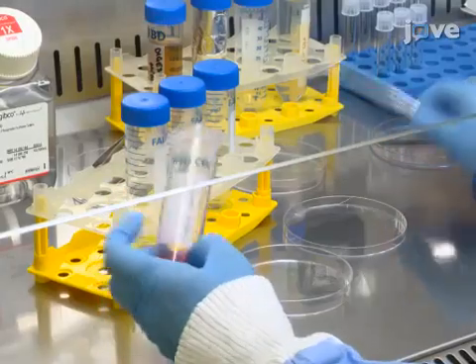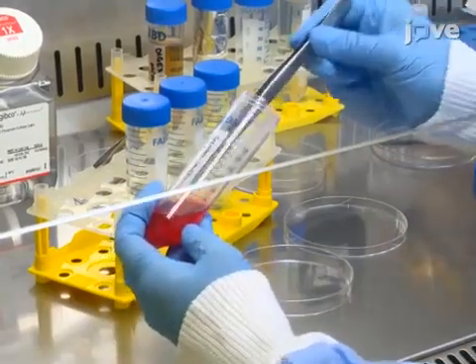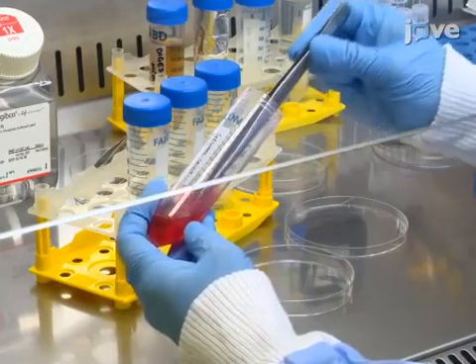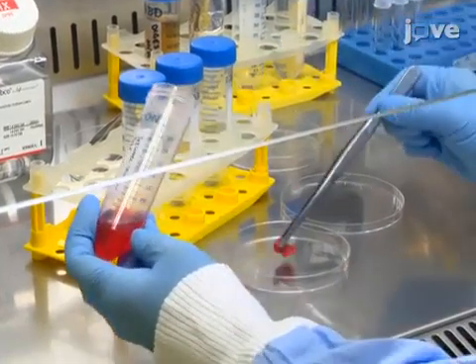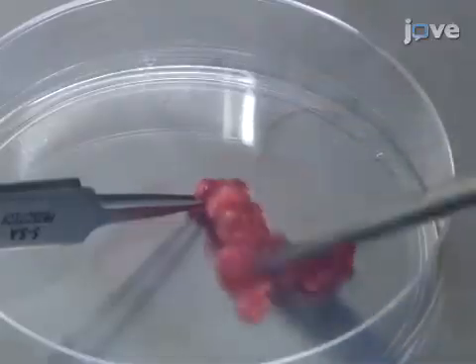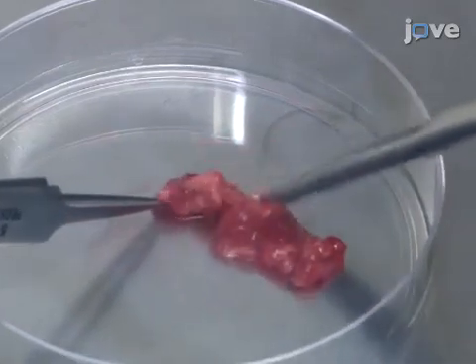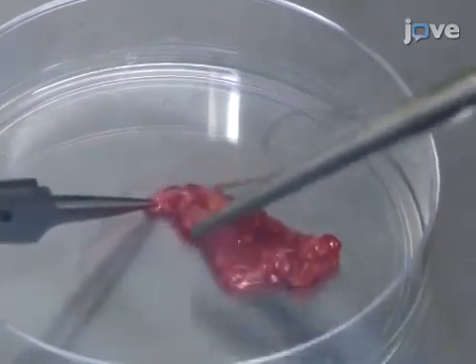Next, in a class 2 biosafety cabinet, use sterile forceps to transfer the tissue and medium into a 100-millimeter tissue culture dish. Using sterile scissors, finely mince the tissue into 1-cubic-millimeter pieces.